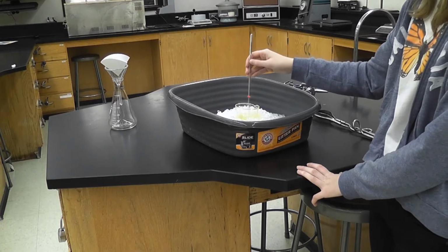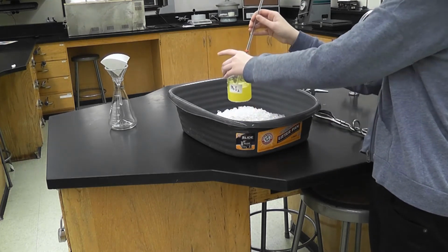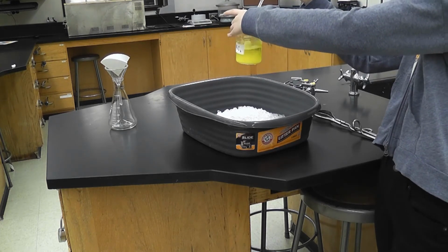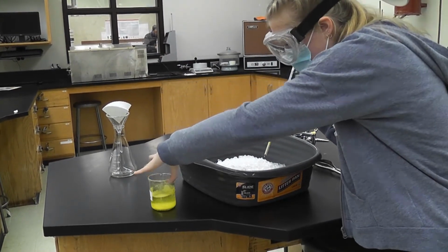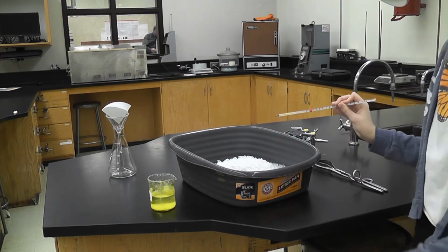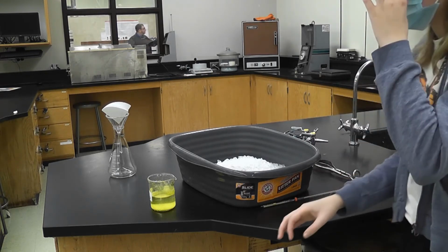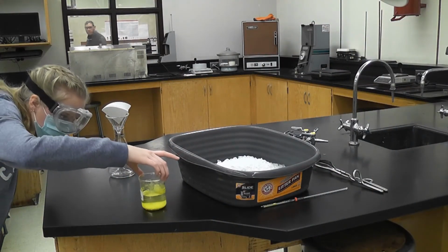We're at room temperature now, Dr. Fard. Do you want me to take it out of the ice? Sure. Okay. Remove it from the ice. Oh, look how pretty. It's so pretty. Yeah, it is, isn't it? See the crystals here? It helped recrystallize, and those are definitely going to get caught in the filter paper now.